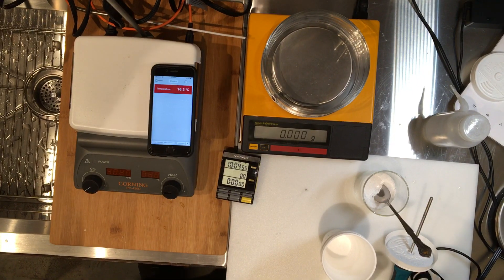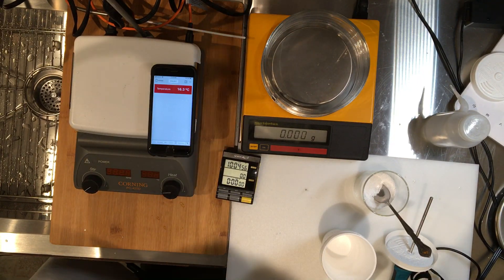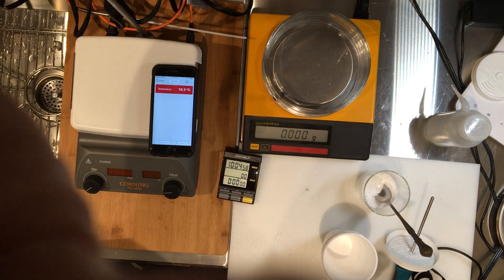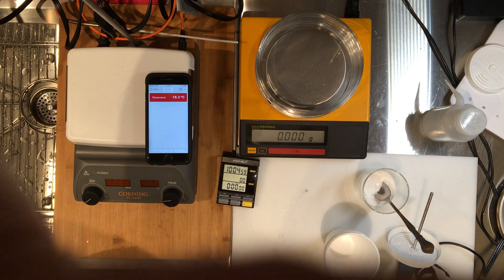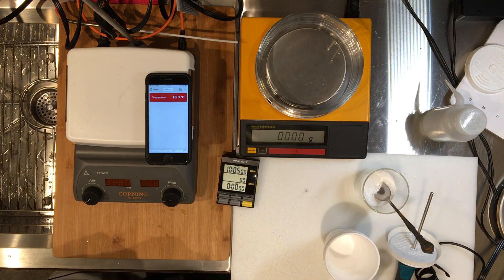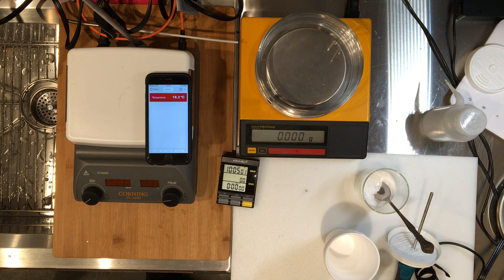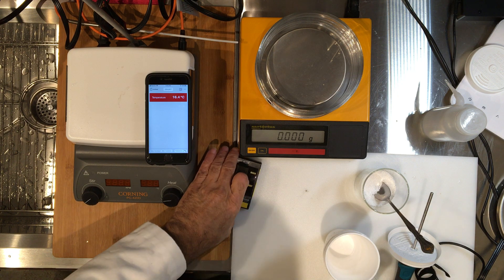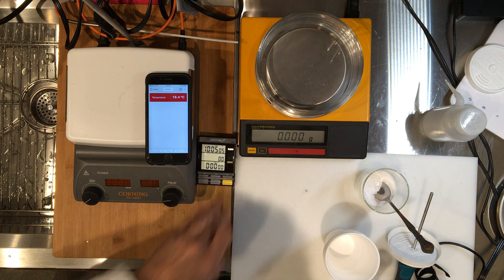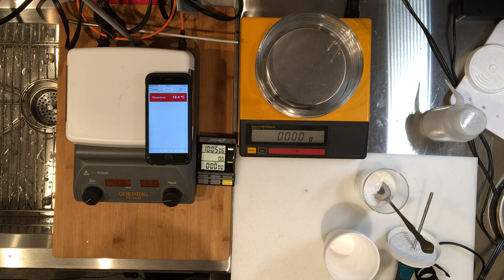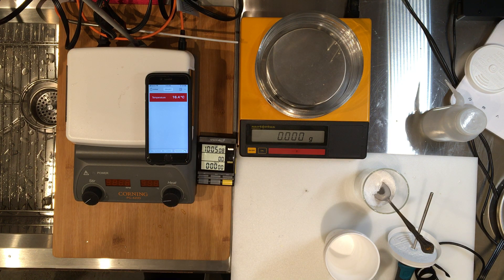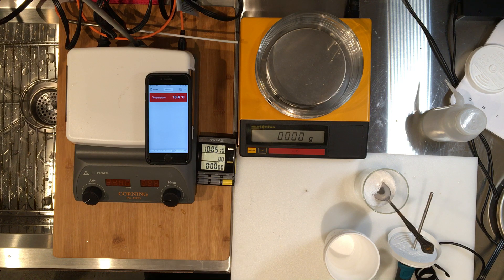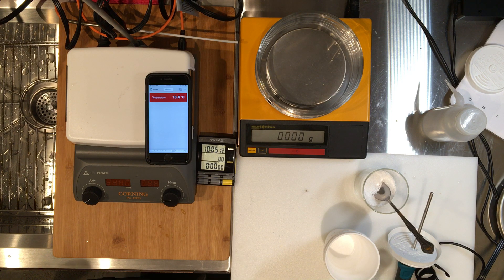Okay students, we are ready to start, so I want to explain to you what you're going to be doing. Please make sure you have your lab notebooks in front of you and have your data table ready to record time versus temperature for every one of these trials that we're going to do.